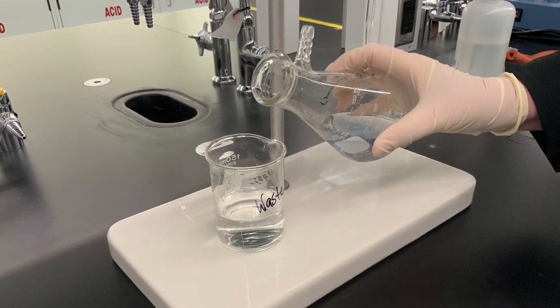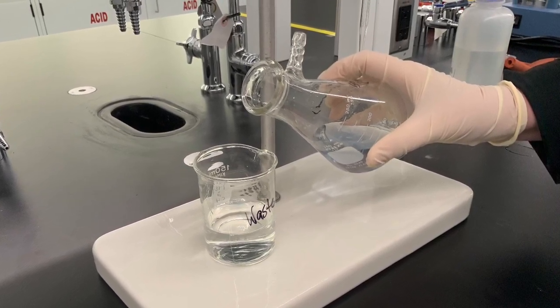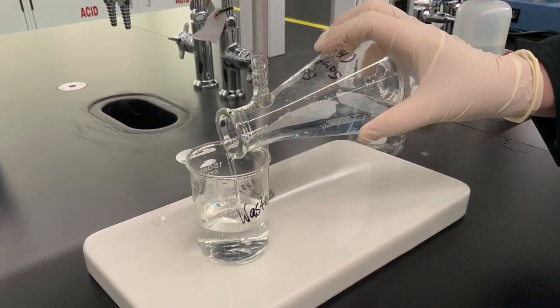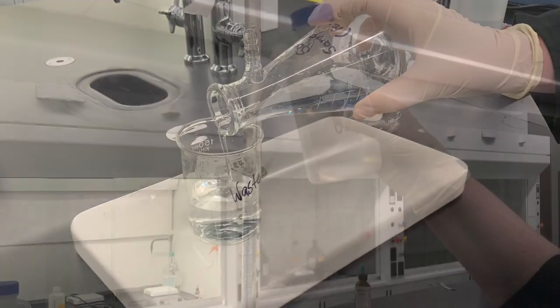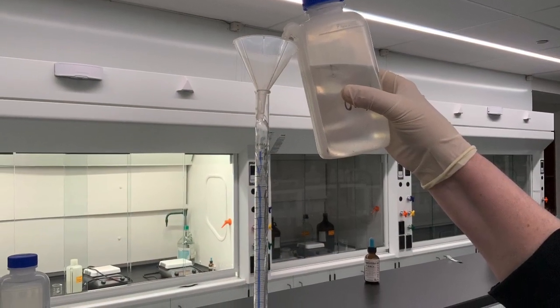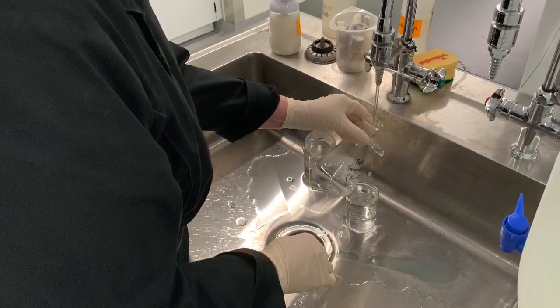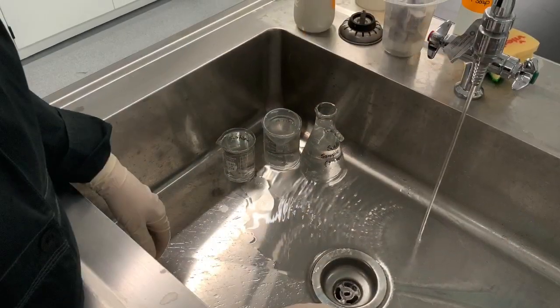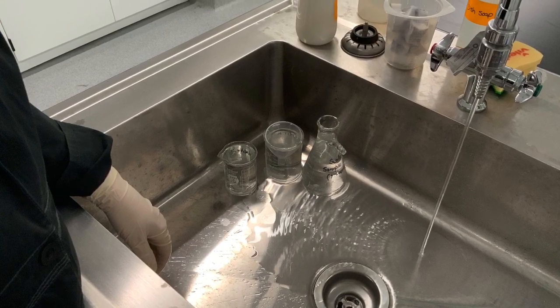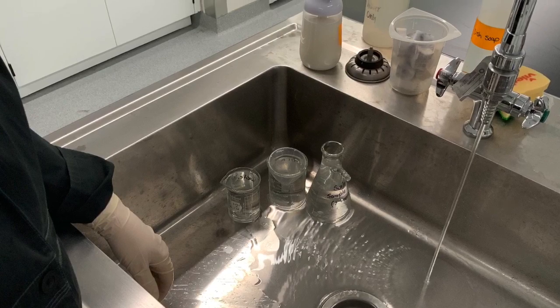The titration is finished, and before we leave, we now pour all the liquids into a waste beaker. We rinse the burette with plenty of distilled water. All these rinses go into the waste beaker, and then everything gets poured down the sink with plenty of water. There's nothing toxic in our experiment, and we can then wipe down the burette with some disinfectant wipe and leave the lab, but of course not before washing our hands with plenty of soap.